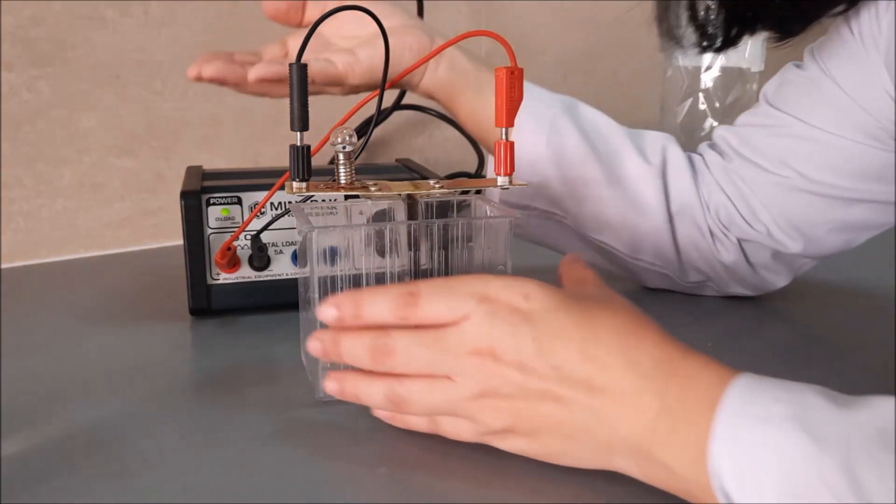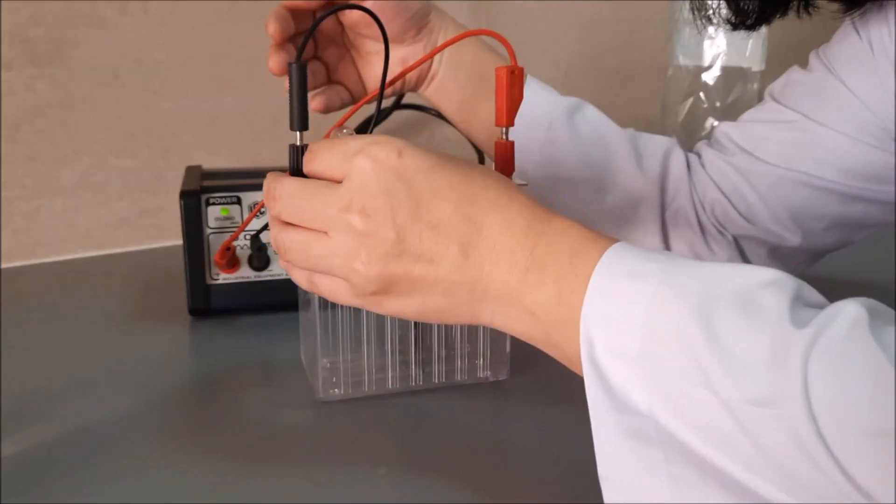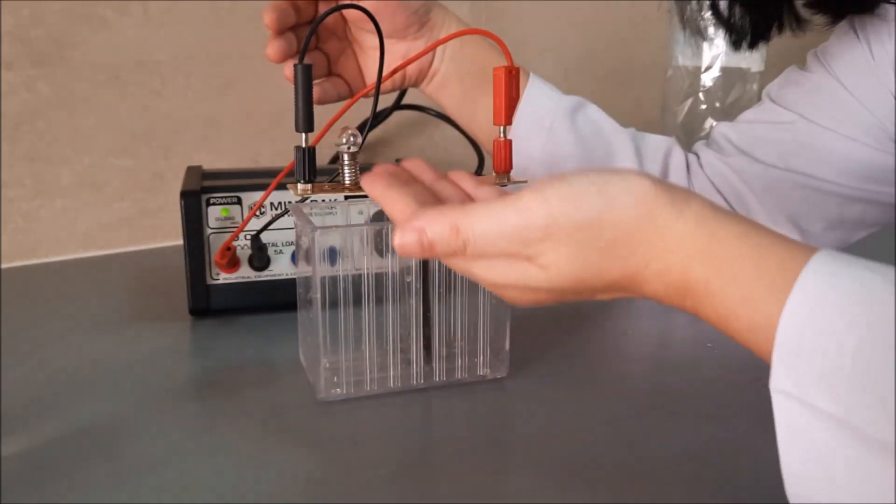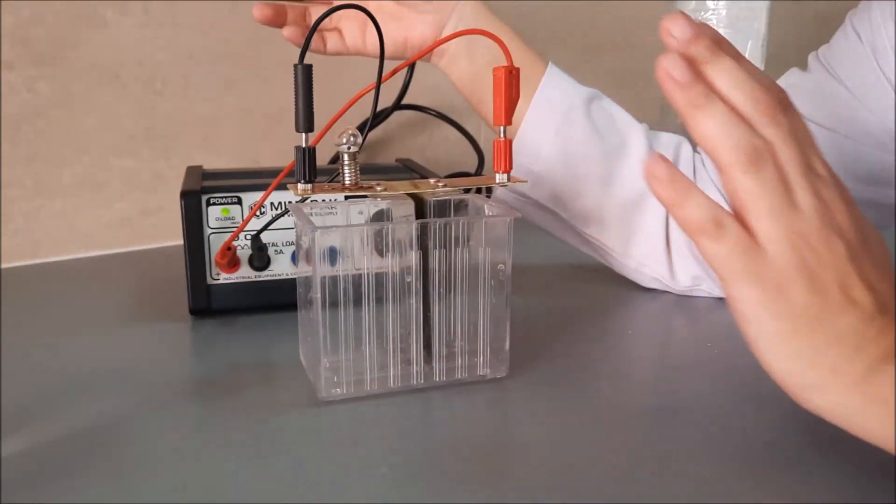As you can see, the light is not lighting. It means this thing does not conduct electricity.